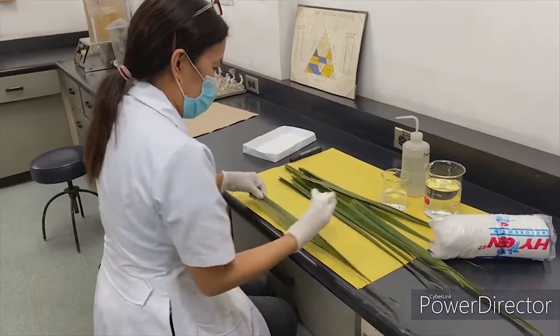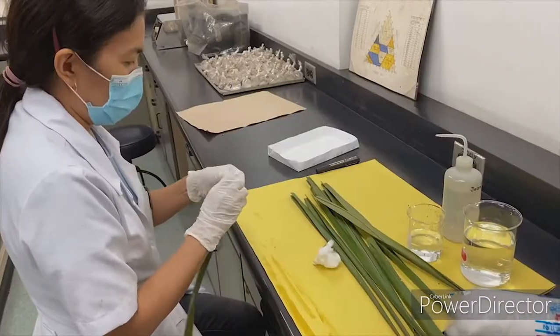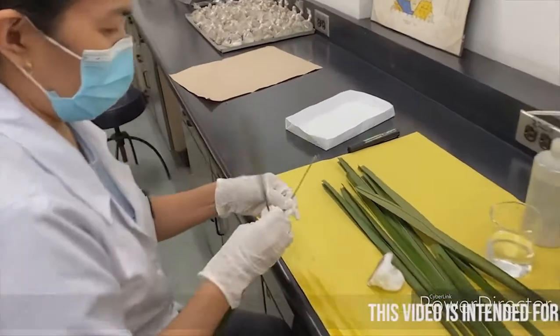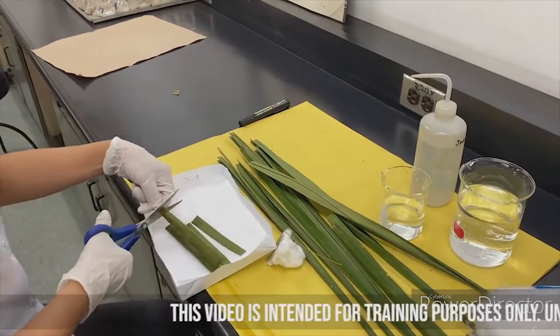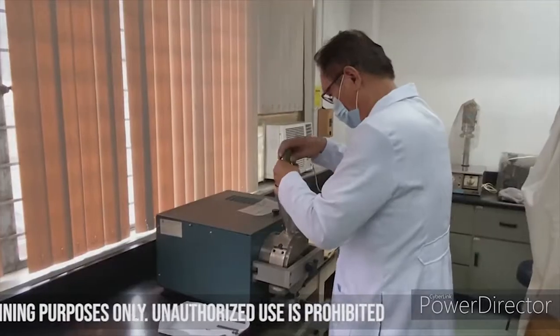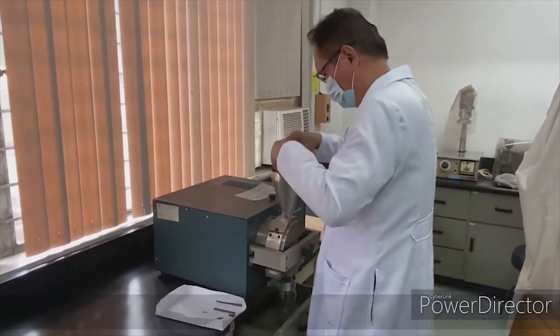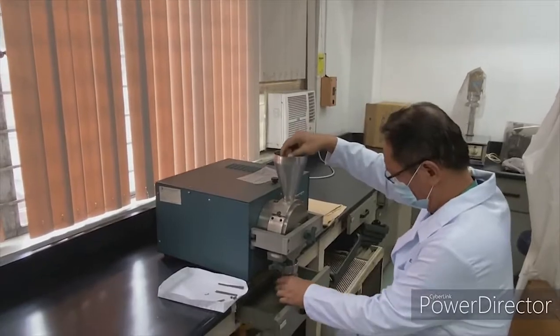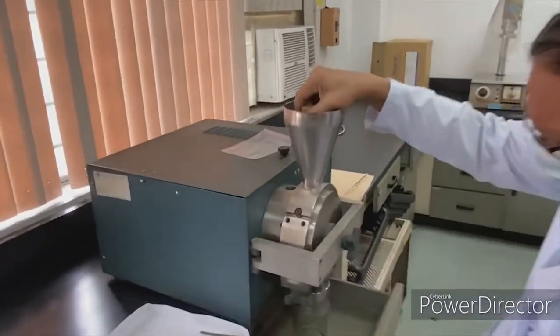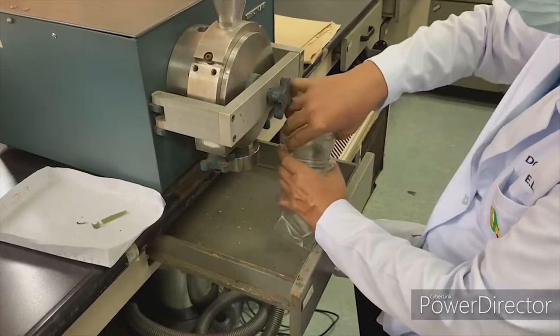The plant samples are cleaned first with cotton and distilled water. The midrib is then removed from the leaves before drying in an oven at 70 to 80 degrees Celsius for several hours. Once dried, the leaf samples will be ground to powder form using the mechanical grinder with the resulting size of about 1 mm. The samples are then transferred to a container and endorsed to the laboratory for analysis.